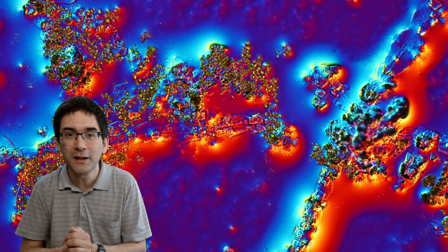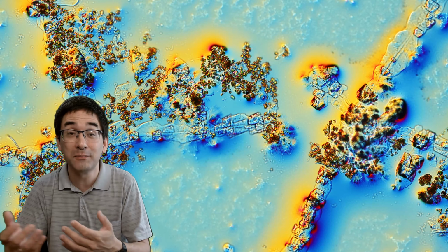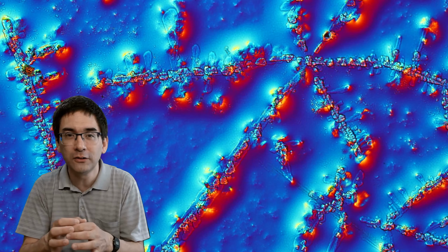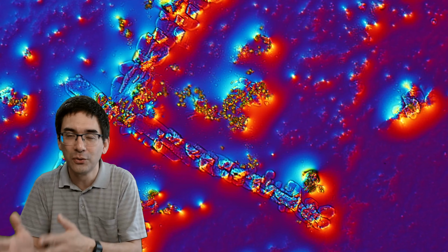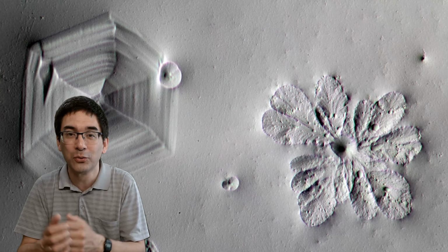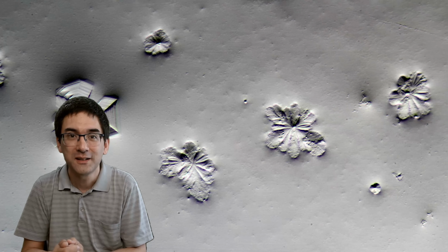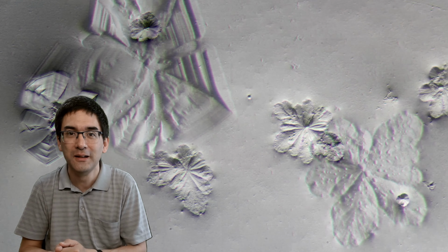Yeah, so again, a few more pictures, and in just a second or so, I'm going to show you some pictures that I've taken some time ago using oblique illumination. That is a special filter that allows light to come only from one side. And if you want to look at those images, I made a separate video 2 years ago. Yeah, here they are. And of course, there is also a link to my original video. Right now, I simply tried it again. Well, some simple experiments to do. I highly recommend it, especially because it produces very nice results, and it's not difficult.